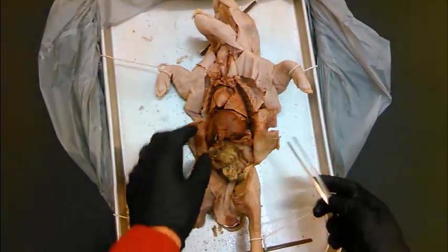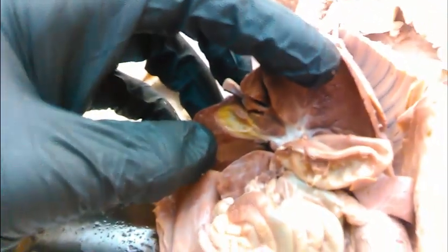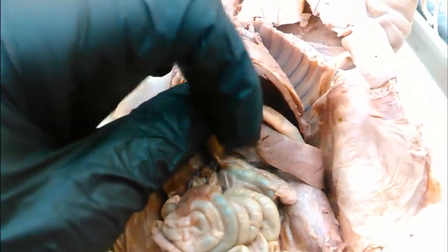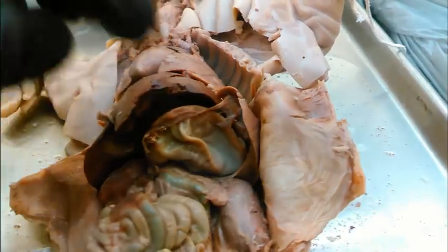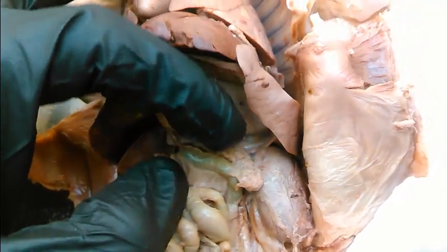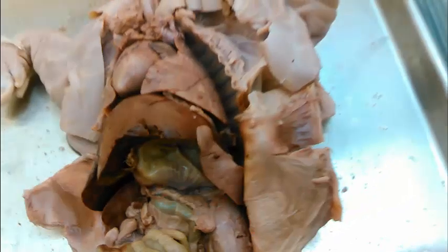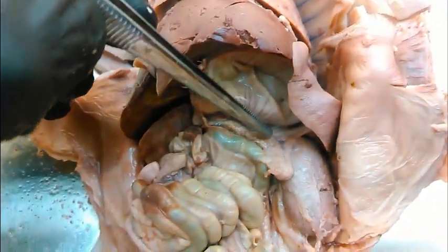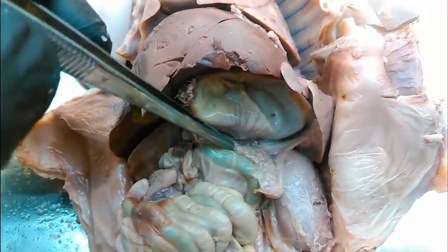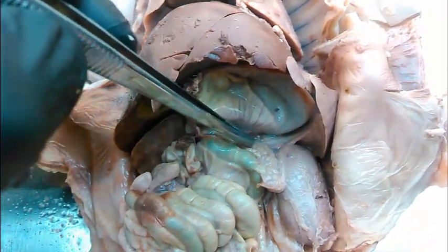The other digestive organs are kind of hard to see, but we can see them here. We're under the liver, and right there in the center field of view you can see the gallbladder. Here's the stomach again. This little thing that looks like a tongue — that's the spleen. Moving that out of the way, you can now see the pancreas. It's this lobular looking structure here. The spleen is over here, and this is the pancreas — that lobular glandular looking structure is the pancreas.